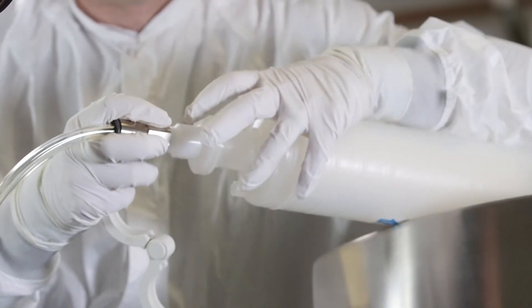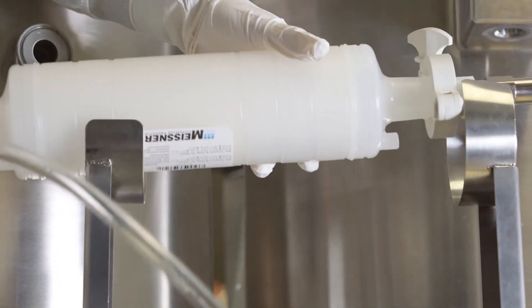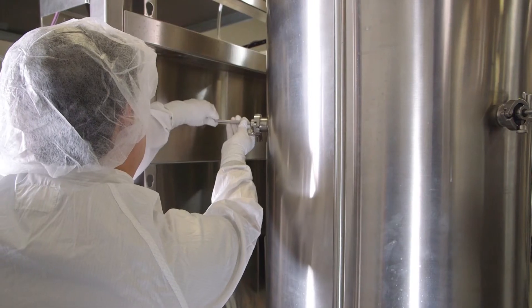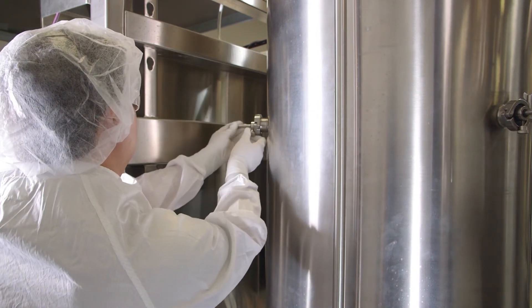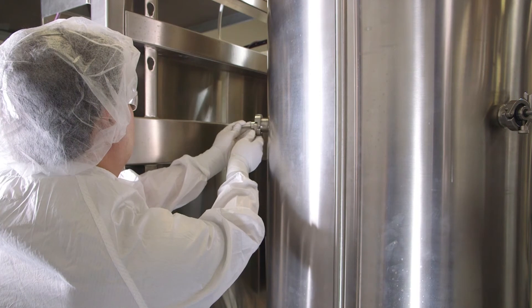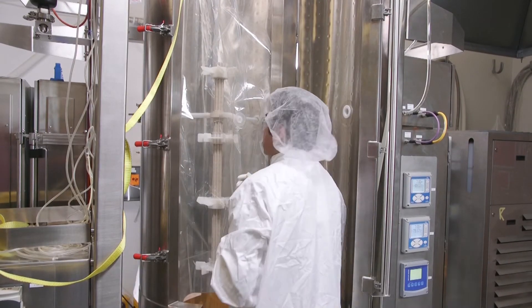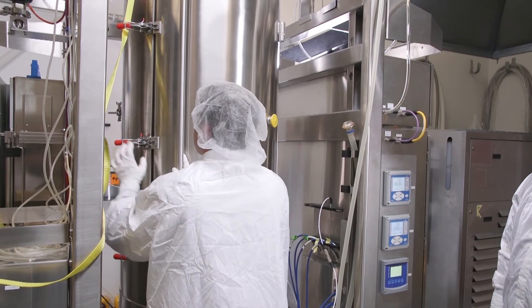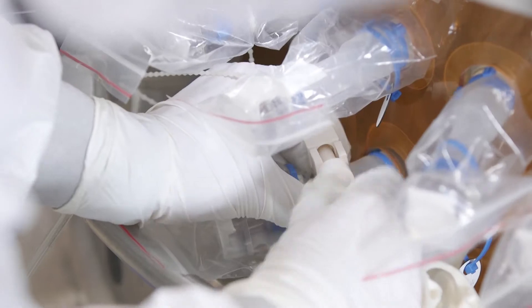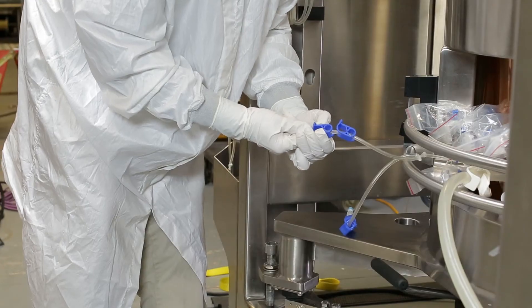Next, connect the sparge filter and the pressure sensor cable. Secure the bag with the support rods. Push the rods through the sleeves and fasten them in position with the screw. Work carefully to not damage the bag. Gently close the door and lock the latches. Also, close all remaining port lines and unused tubing with a clamp, and remove zip ties.